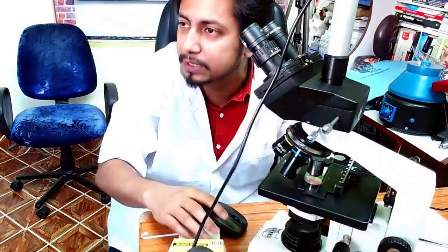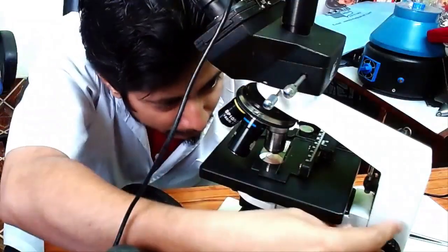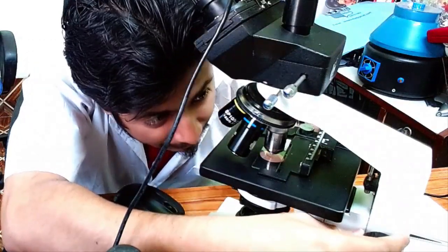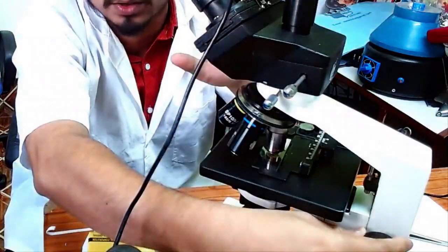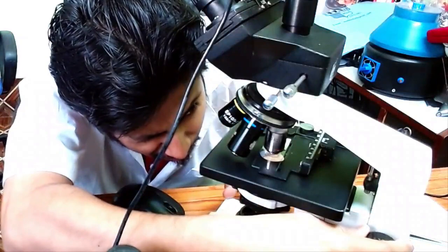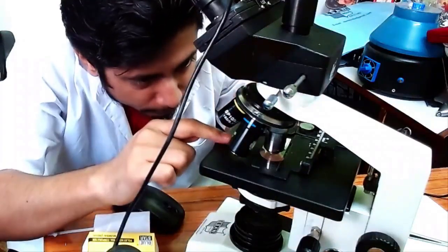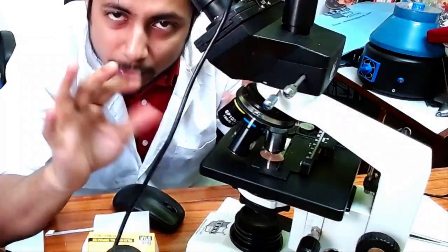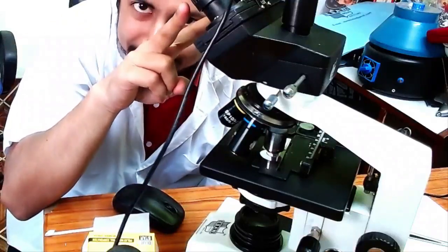We are going to keep raising the stage as much as we can, until the lens nearly hits the slide. We go to the maximum extent — achieving the minimum distance between the objective lens and the slide. That is the point where we stop. Up to this point, we have not put our eye into the eyepiece at all.